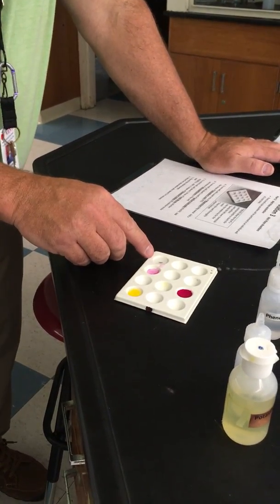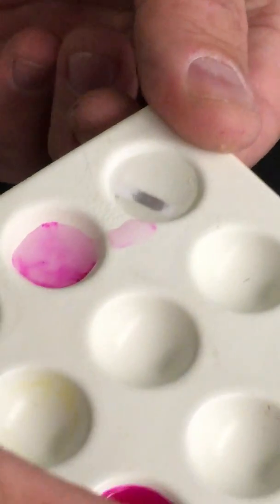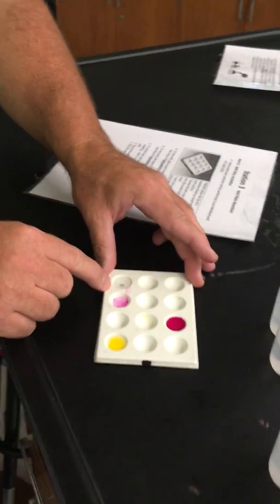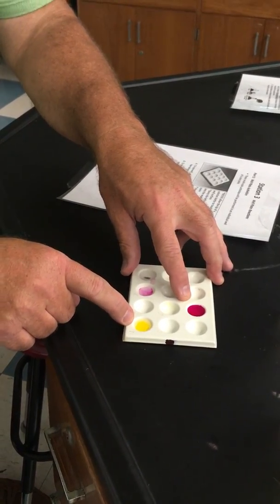If we go back to that acid thing, it's slowly eating the metal away, and I'm going to touch the bottom of the well, and it's very, very hot. So the release of light or heat is another sign of a chemical change. So the release of light or heat, gas bubbling, and color changes are all signs of chemical change.